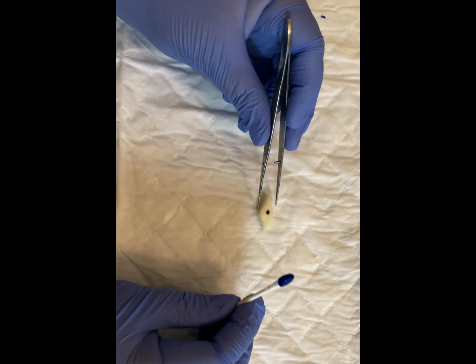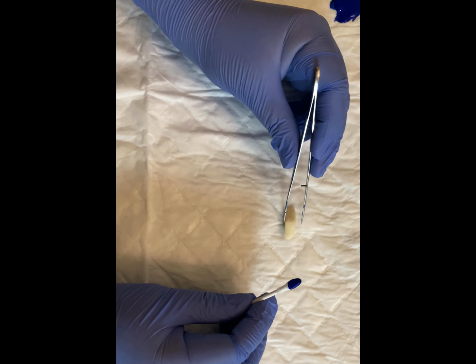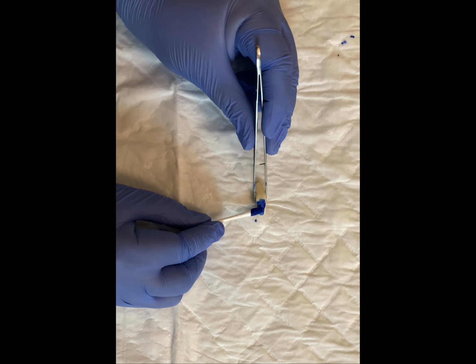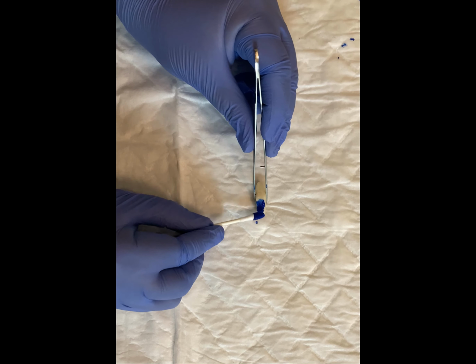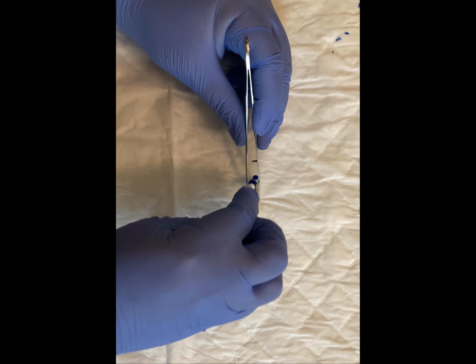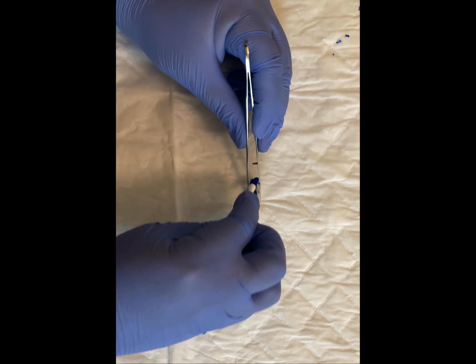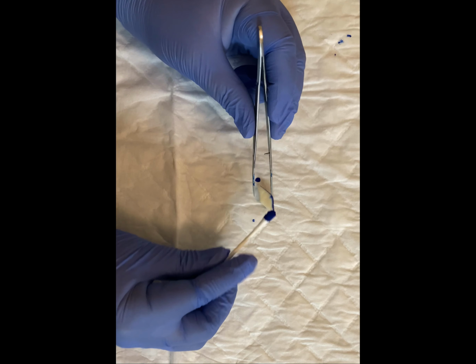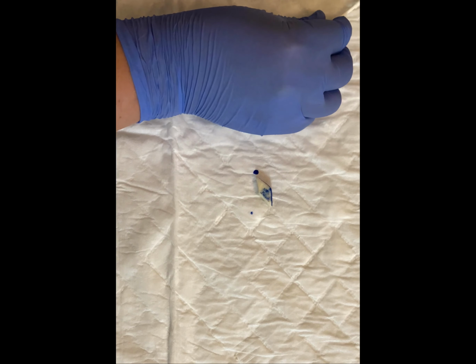Step 3. Ink margins. Next, we will ink the subcutaneous tissue or margins of the specimen. Be careful not to apply too much ink, as it can cause the ink to be dragged into the tissue when sectioning. For an unoriented skin excision, we will only apply one color of ink, in contrast to an oriented skin excision, which will require two colors of ink to properly designate laterality.